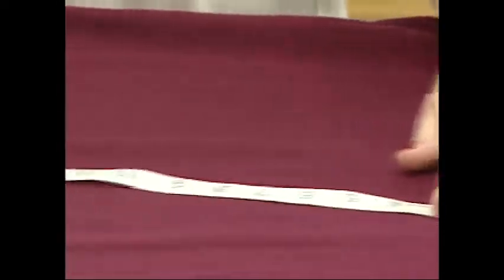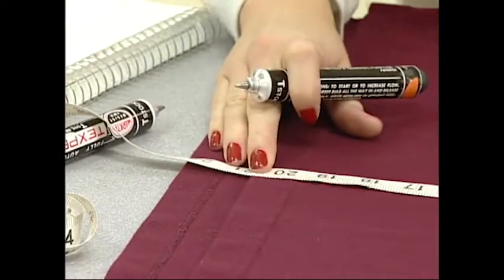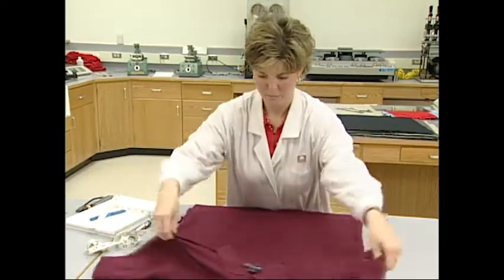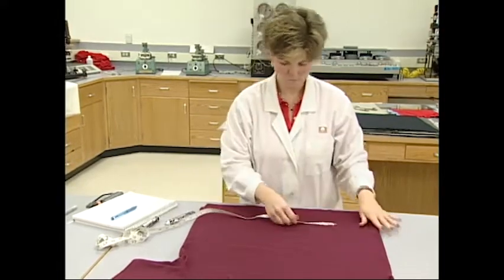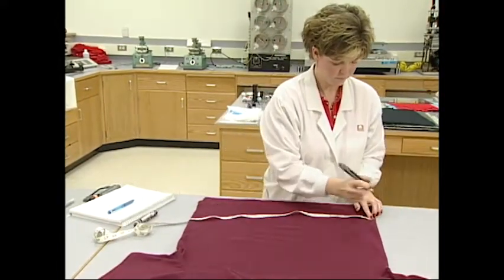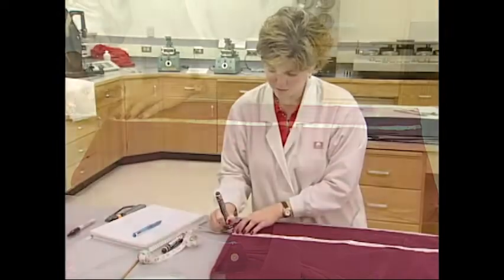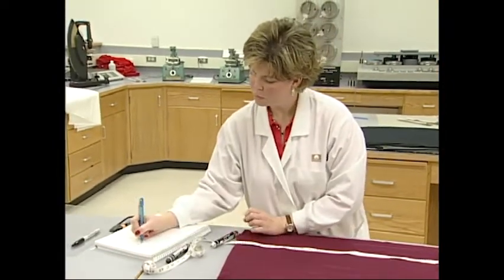These benchmark locations are covered in detail in AATCC Test Method 150. Knit shirts are evaluated for shrinkage by using benchmarks and, in some cases, with shrinkage squares. In the basic method, a knit shirt is laid on a table and all folds and wrinkles are carefully spread out with the front of the shirt facing up. For shrinkage measurements, the shirt is marked and measured at several locations before laundering, and the same marks are measured after laundering.